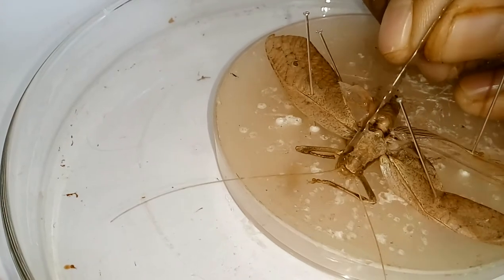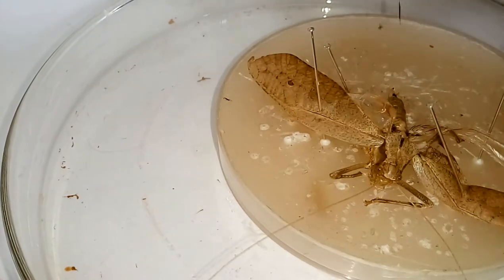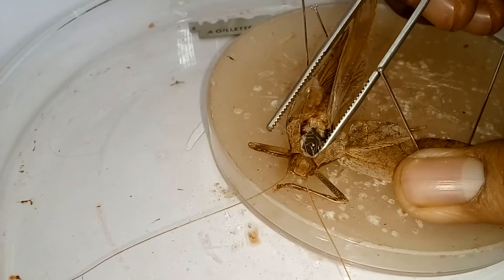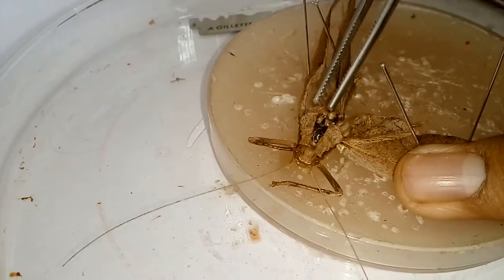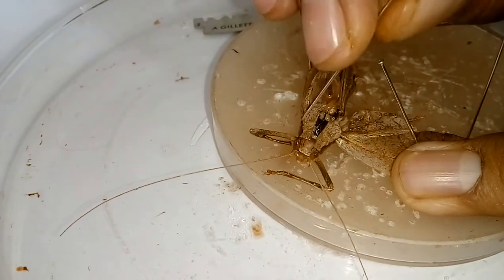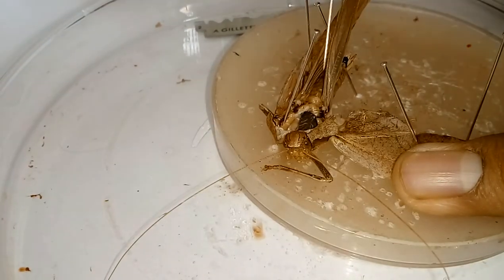After pinning in the wax plate, from the same portion we cut before, try to cut the area of the pronotum very slowly and clearly. Please try not to cut too deep as it is very delicate, otherwise we will cut parts we need. I am just splitting the two halves of the pronotum using a forcep, and when we open these two halves, we use entomological pins to keep them separated and opened.